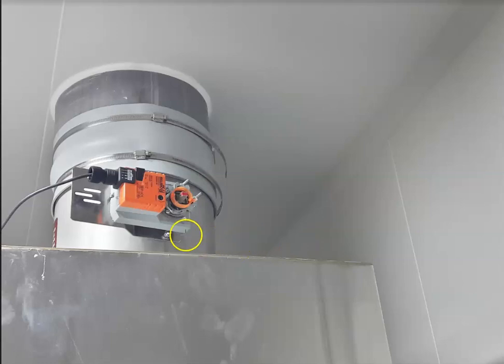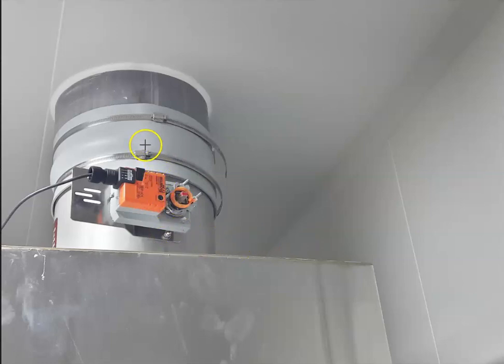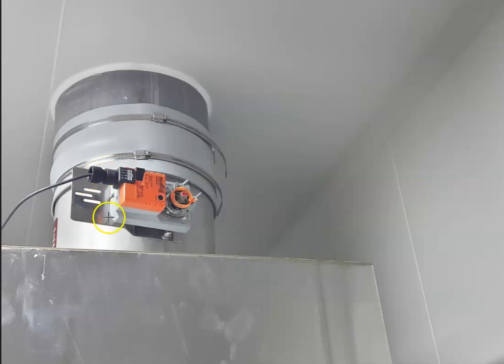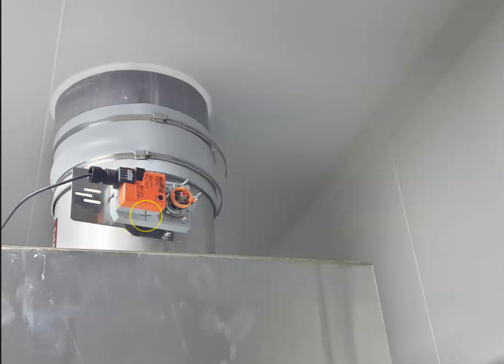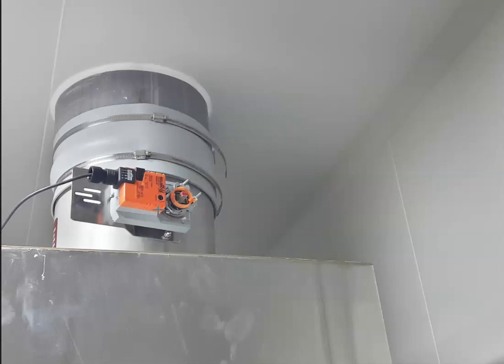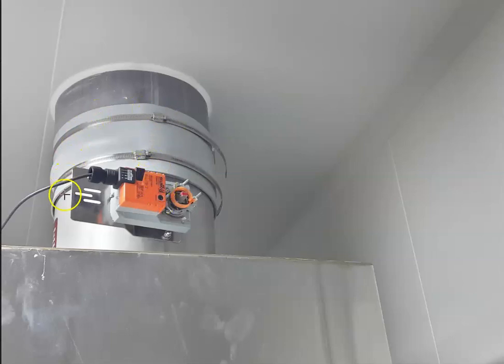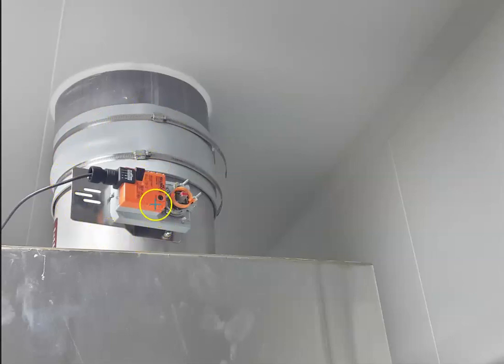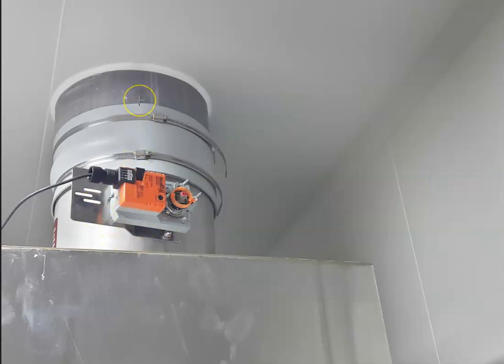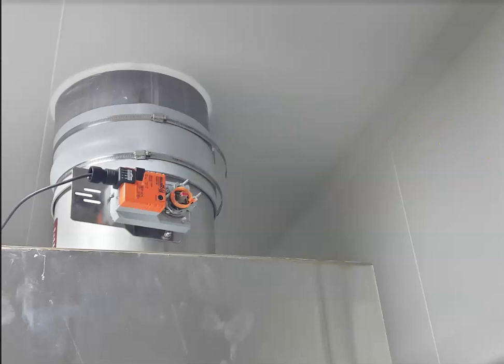On the upper section of a biological safety cabinet you will notice a valve. This is a hard-ducted cabinet, which means that the cabinet airflow is directed out of this cabinet through the HEPA filter and then on into the environment.